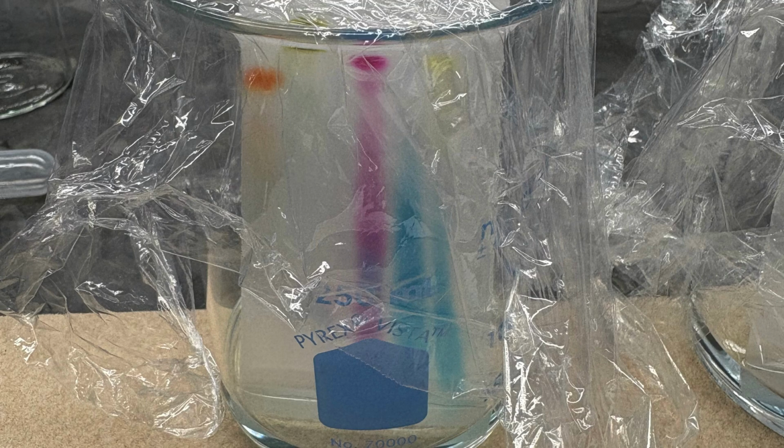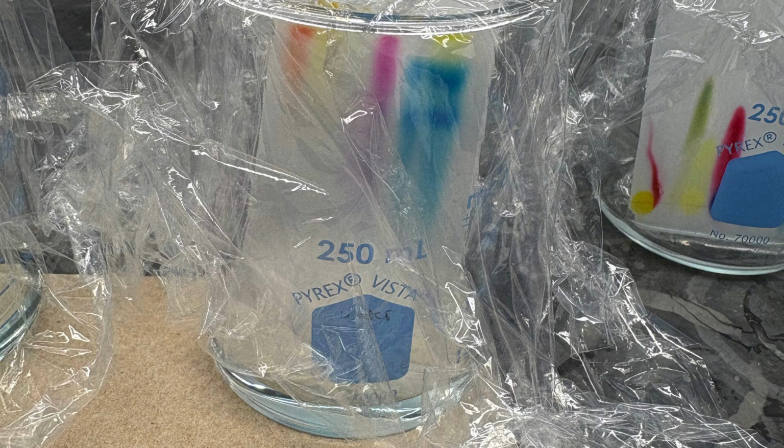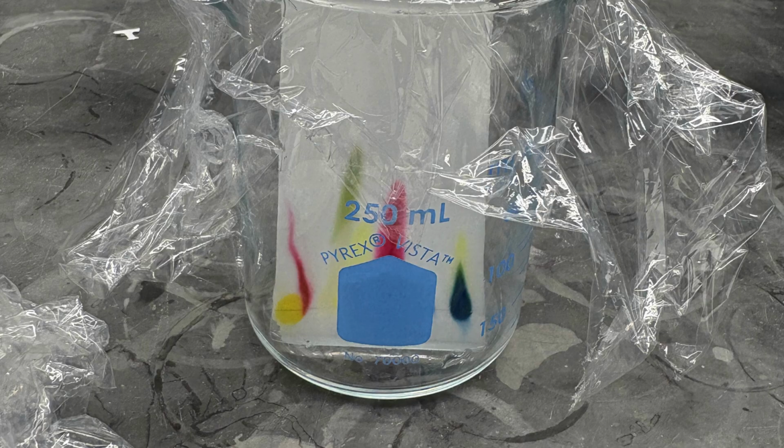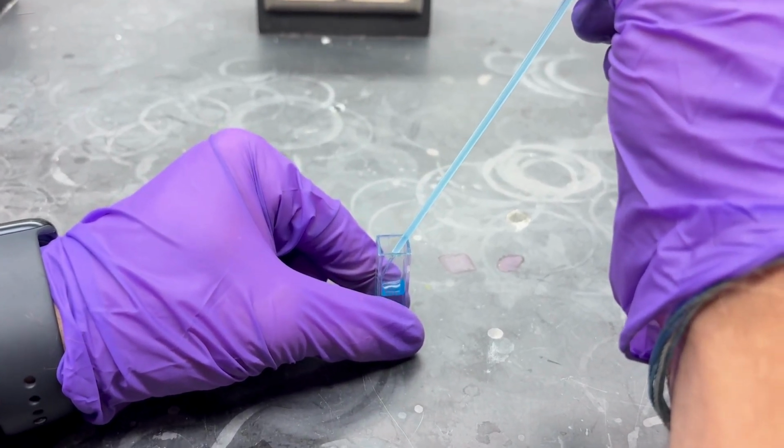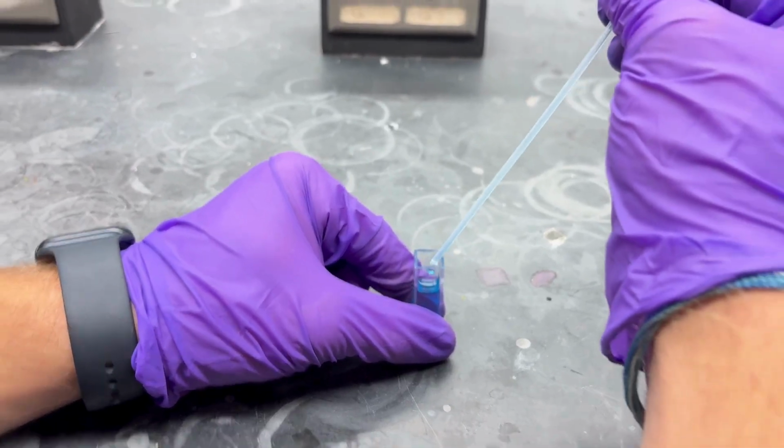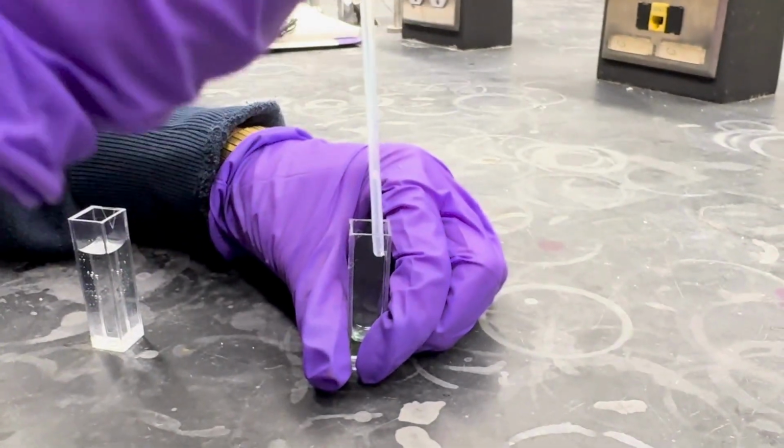First, I'll begin by showing you our chromatography paper and us filling the cuvettes with the solution. Then, we started scanning for absorbance. We scanned our samples across all wavelengths to determine the best wavelength for measurement. Scanning across all wavelengths helps identify the maximum absorbance, called the lambda max, where the sample absorbs the most light.